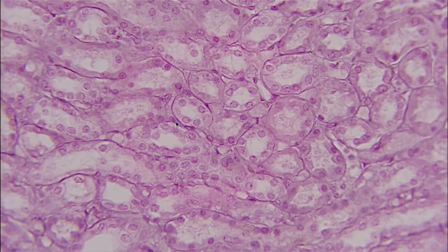And again, we're going to be looking from the basal to apical surfaces. And so here we're going to see that clear outline right here on this one. Those are going to be our basal surfaces, and our apical surfaces are going to face the lumen, which is going to be this right here. And so we can kind of see, especially in all of these, they're kind of circular. On some of these we have a bit more of an elongated shape, but here we're going to see we have one layer of cells facing the inside, have our basement membrane right there, and this is going to be simple cuboidal. You can kind of tell they look a bit circular sometimes. We call them cuboidal because sometimes they look like squares.